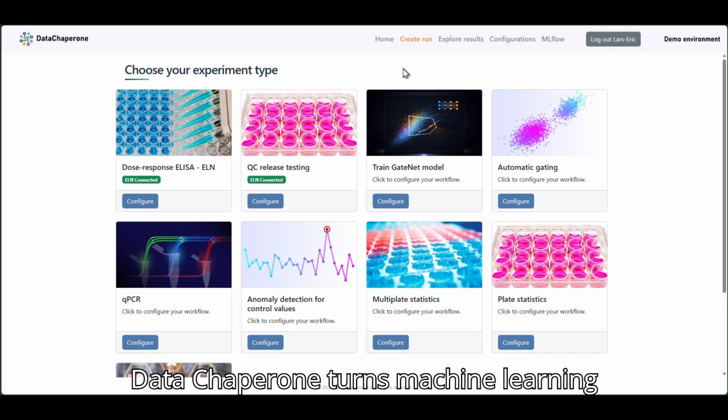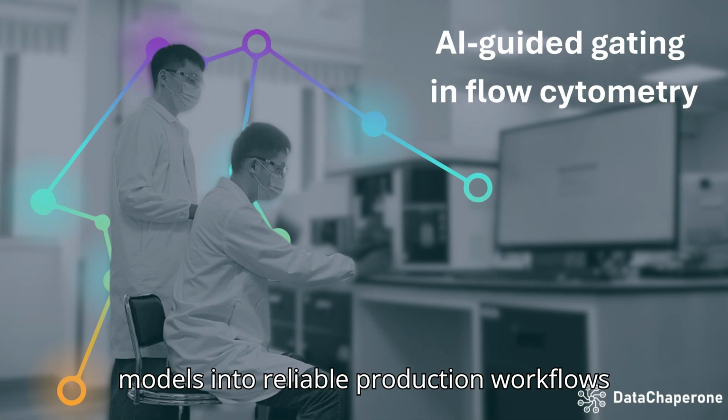This is how DataChaperone turns machine learning models into reliable production workflows for the lab.